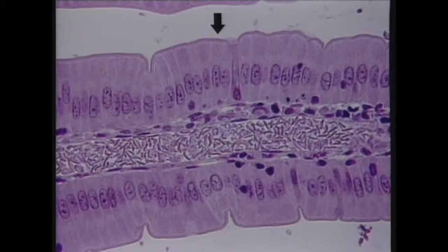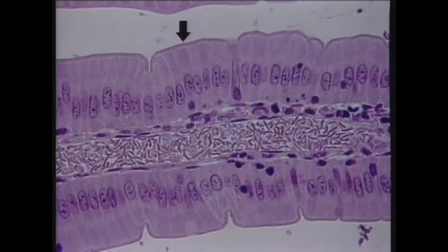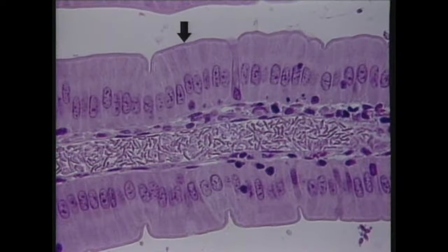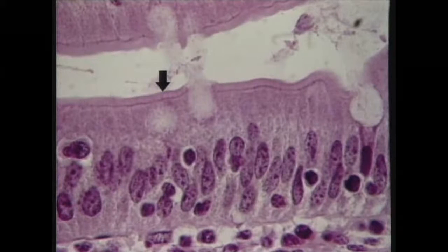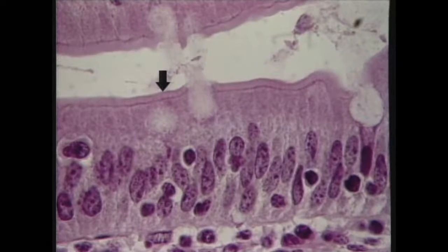There's another kind of very important cell surface specialization called the microvillus, and the plural is microvilli. This is a light micrograph of an intestinal villus, and each of the intestinal epithelial cells here is covered by a group of microvilli. Now, they're too small to individually resolve with the light microscope, but taken together they form this structure here, which is called the brush border, which is a whole bunch of microvilli arranged in a row. Now let's have a look at this at higher magnification on the next slide. This is a light microscopic image of the same specimen we were looking at, but taken at higher magnification.